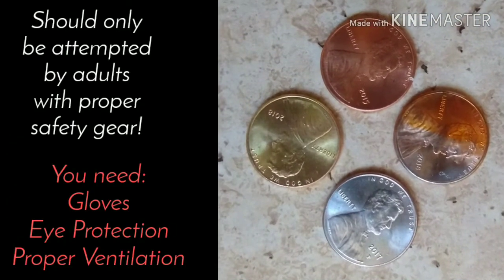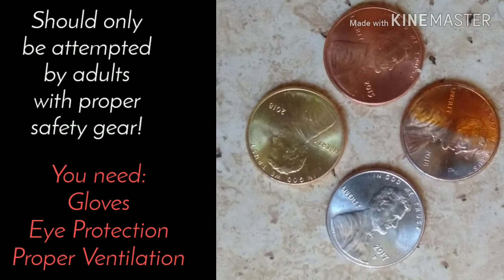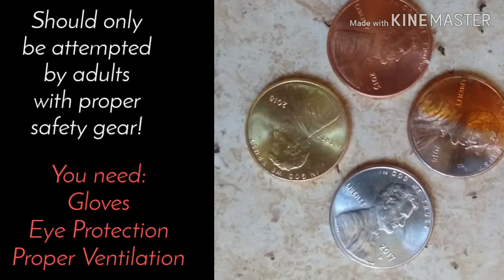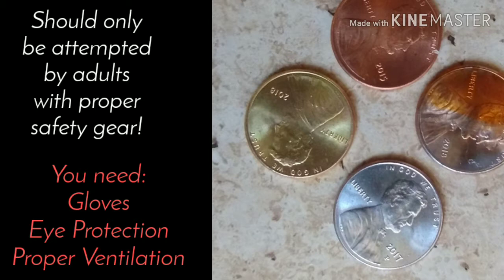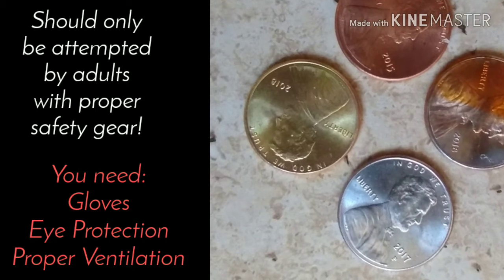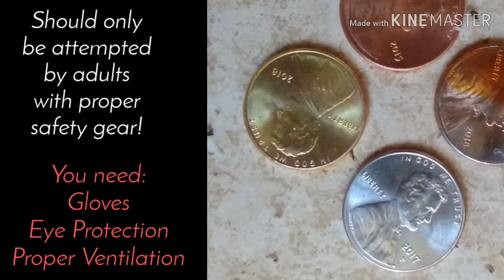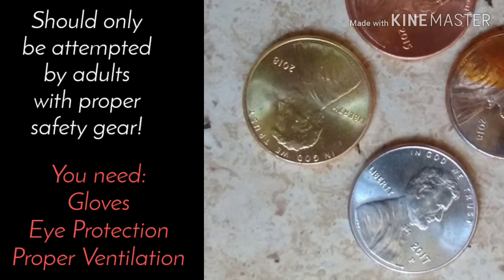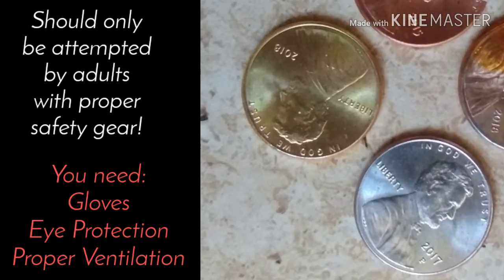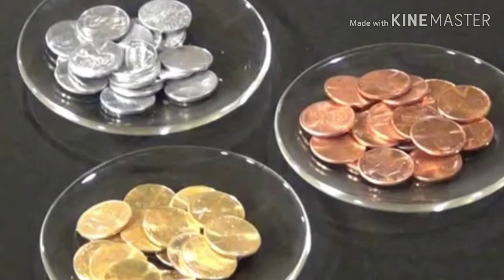Now we're ready for our chemical change — our penny experiment. With so many of these chemical experiments, it's really cool to show you how they work and the science behind them, but safety is really important. Don't attempt this if you're a kid, or if you're an adult but you don't have the proper training or safety equipment to do this safely.